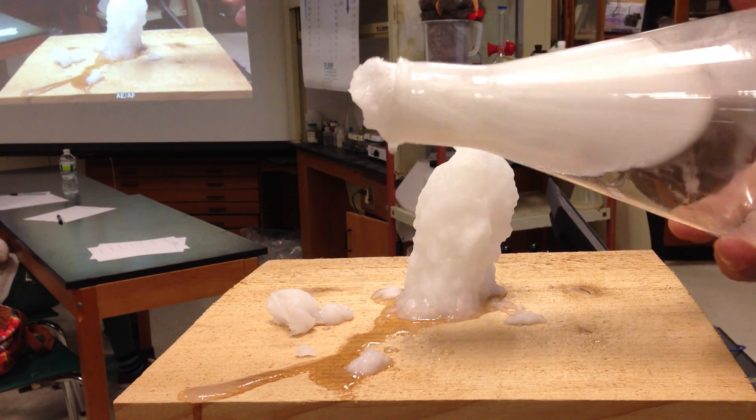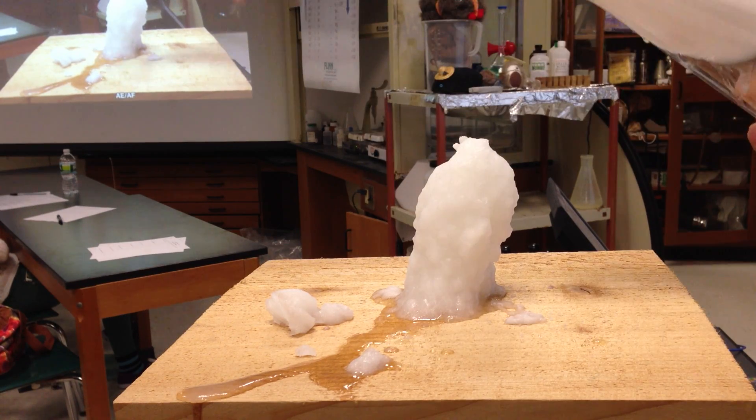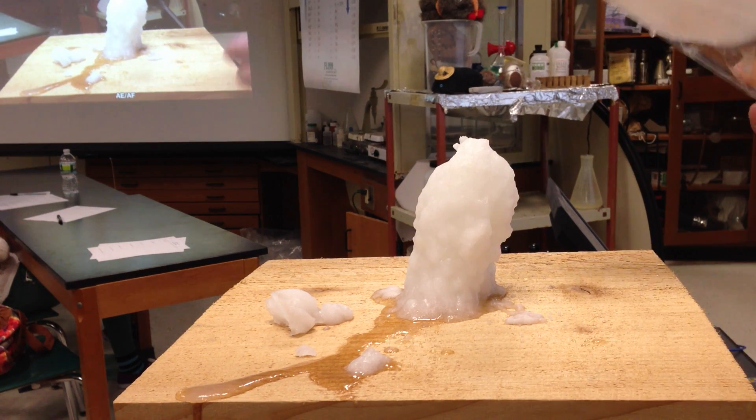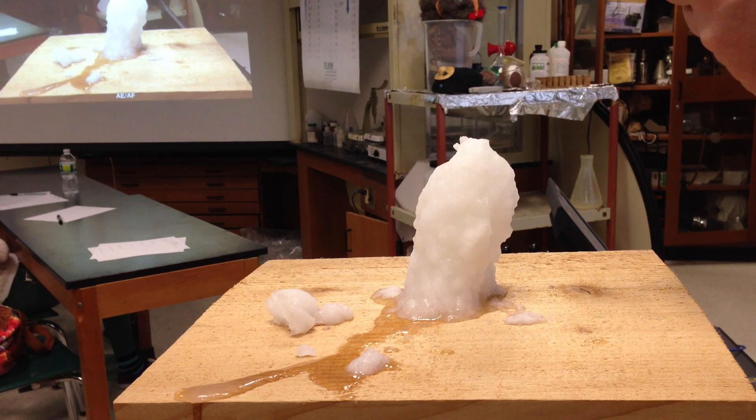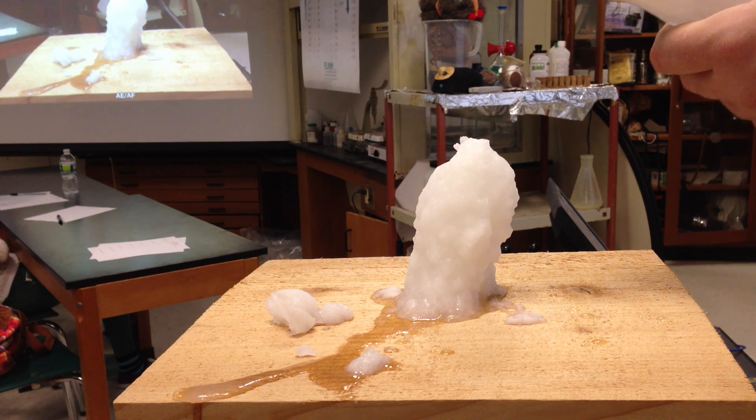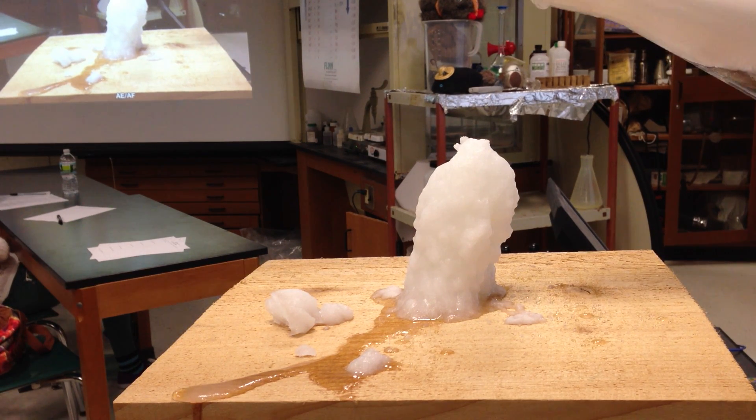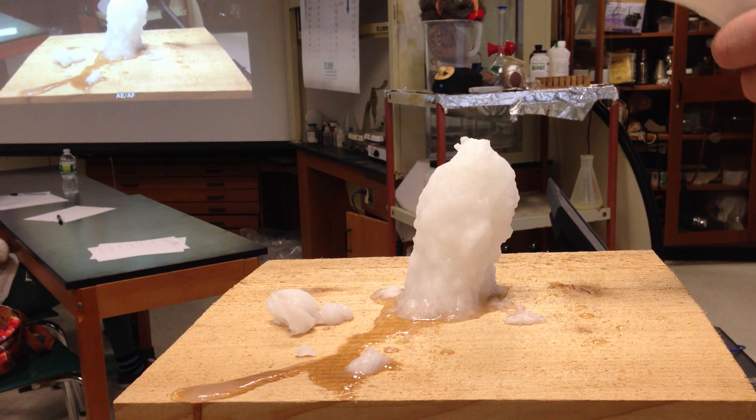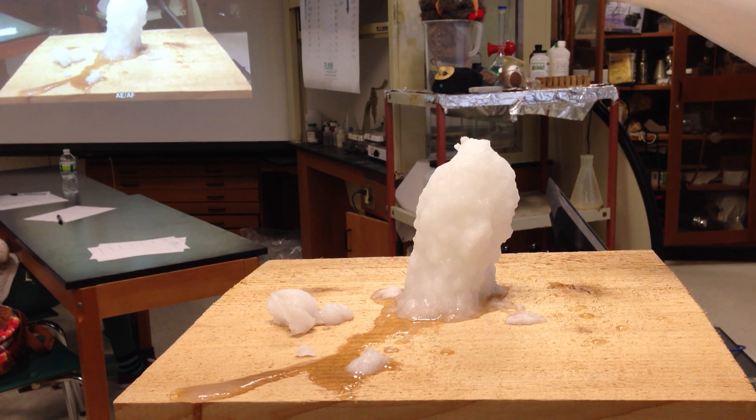And it kind of did both things. You've got both for the price of one going back into the beaker and a little bit of a mountain for me to clean up. So pretty cool. And it's very warm. It's the same material that we had in the hand warmers. And anything that solidifies actually gives off heat. Everything.